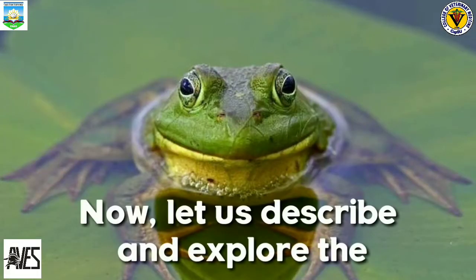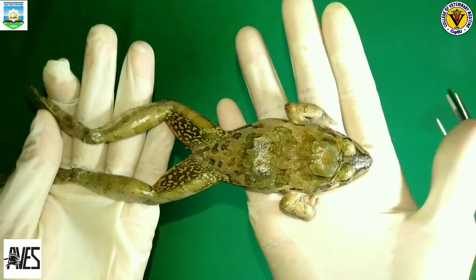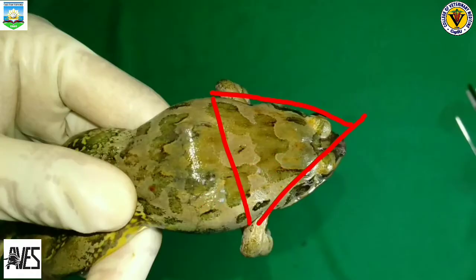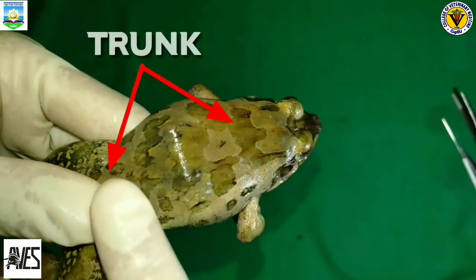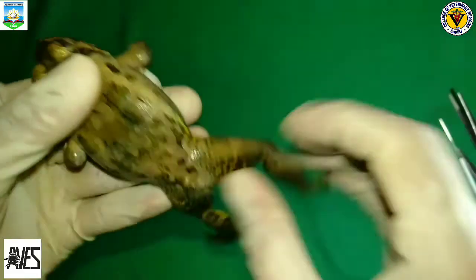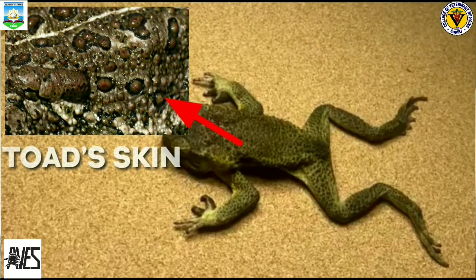Now, let us describe and explore the external anatomy of a frog. This is the head of a frog, the uppermost part of a frog. The head of a frog is triangular in shape with a blunt snout. And this is the trunk of the frog, which is the central part of a frog, to which are attached the head and the limbs. If we study the frog's skin, we can feel that it is smooth and slimy, while this ugly and poor toad has dry and bumpy skin.